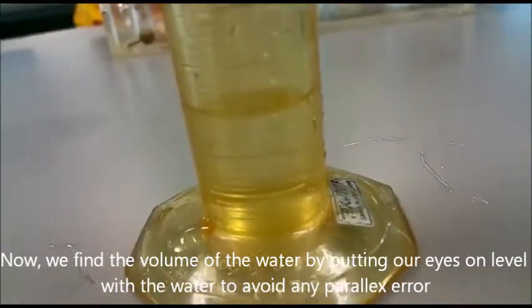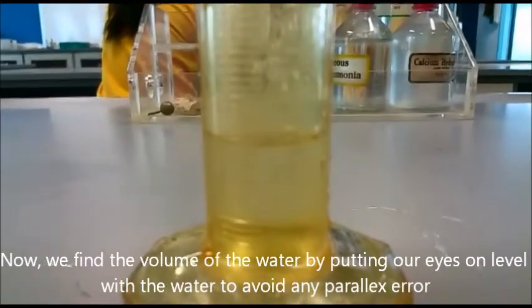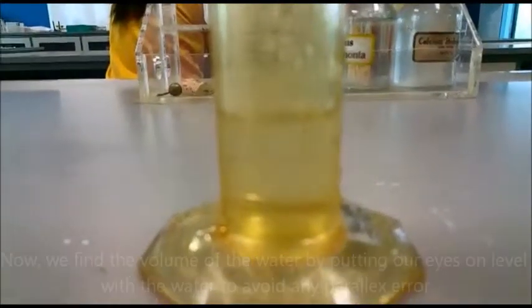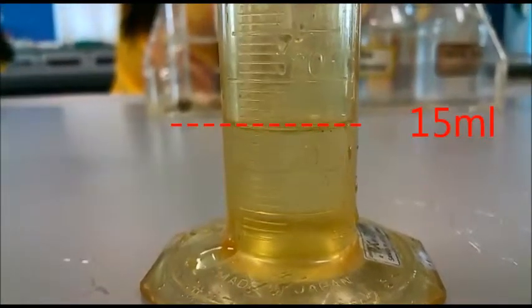Now we find the volume of the water by putting our eyes on level with the water to avoid any parallax error. The volume is 15 milliliters.